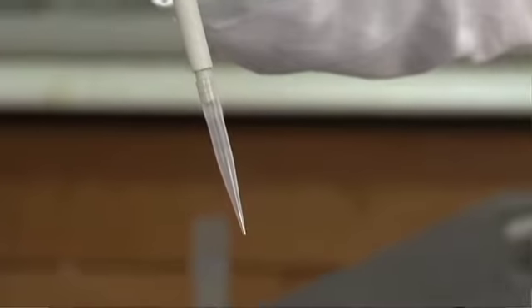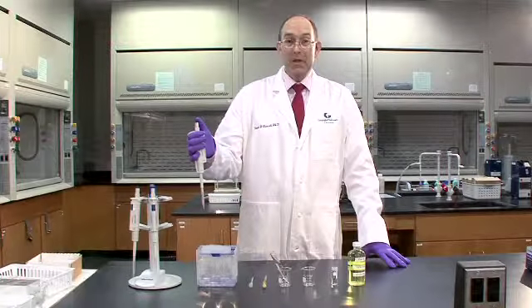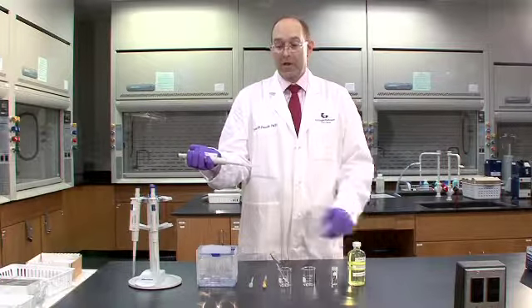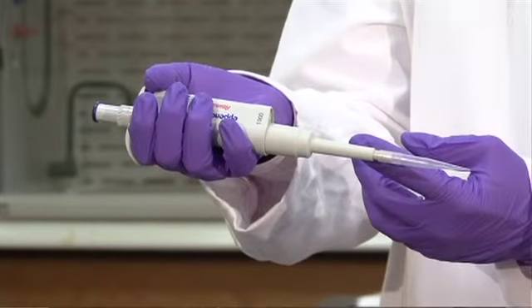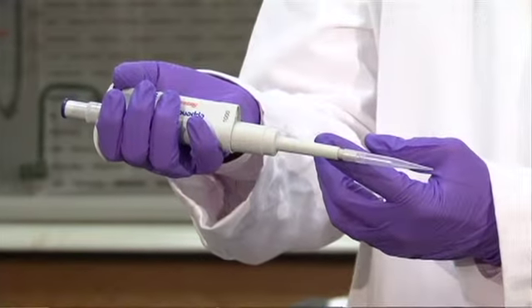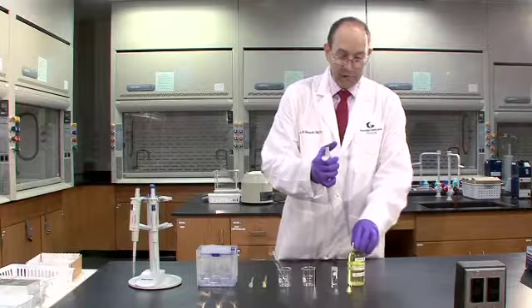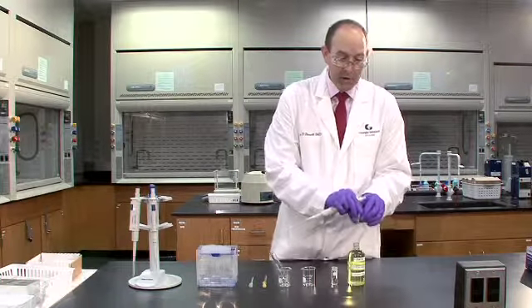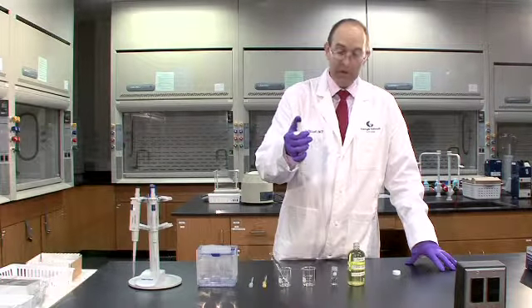So now I've got the ADP and pipette tip. It's very important that I keep the ADP in an upright position as opposed to a horizontal position. When it's in a horizontal position, any liquid that I've got in the pipette tip will run into the ADP and corrode the mechanism in the ADP that enables it to draw liquid up. So with the pipette tip in the upright position, I'll move to a reagent bottle where I want to draw precisely 1.00 milliliters or 1,000.00 microliters of liquid.